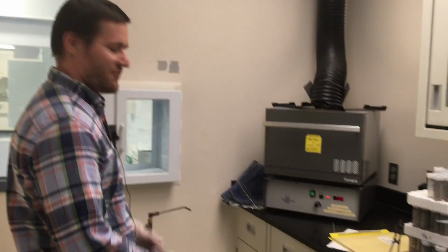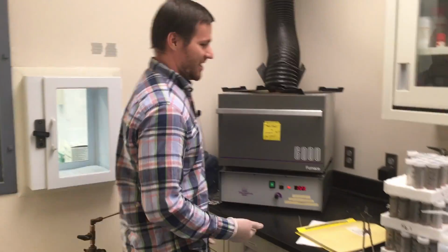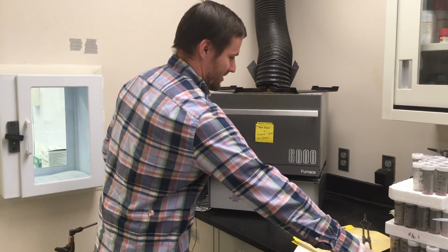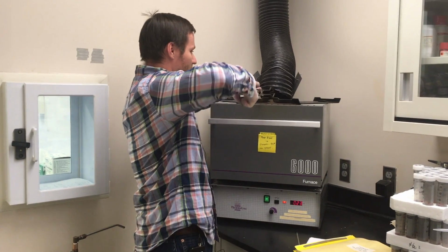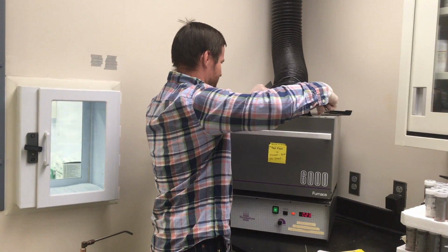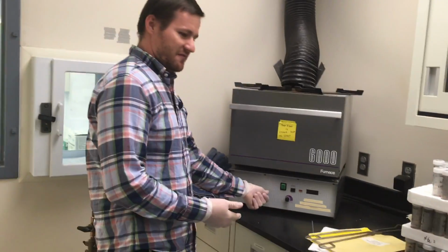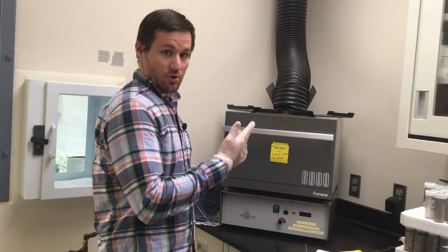Let's pretend that we've run the asher overnight. It is the next day. The first thing I like to do, when I come in the morning, is remove the weight off of the flap, using the tongs. This time the flap will be hot, for sure, and I will move the flap to let it vent. You'll also at this time want to turn off the asher. By turning it off, it will no longer heat. By opening up the vent, the heat that's in there will go away.